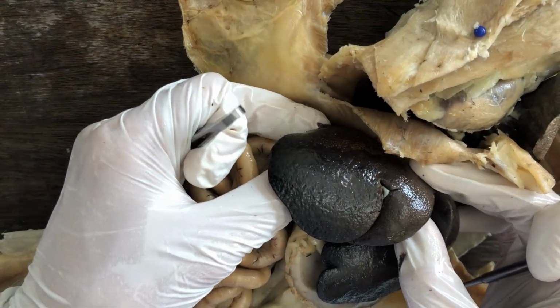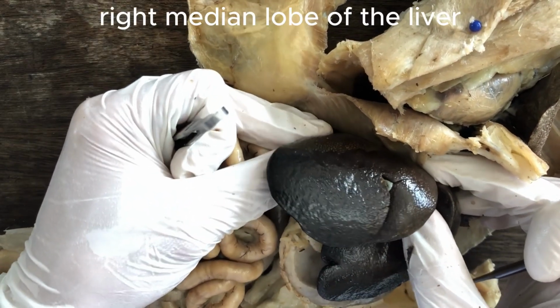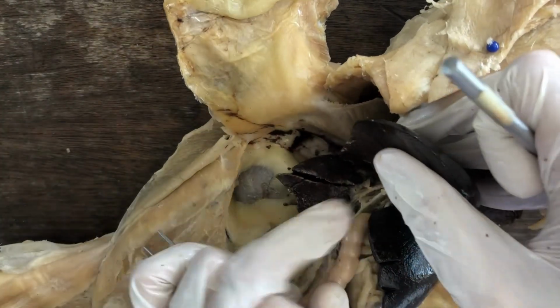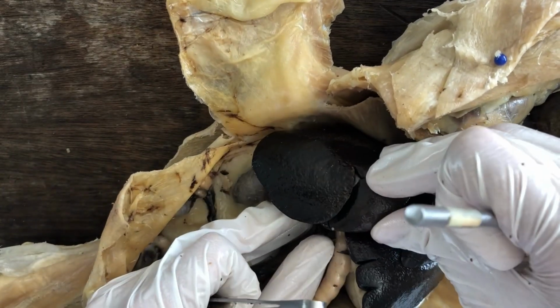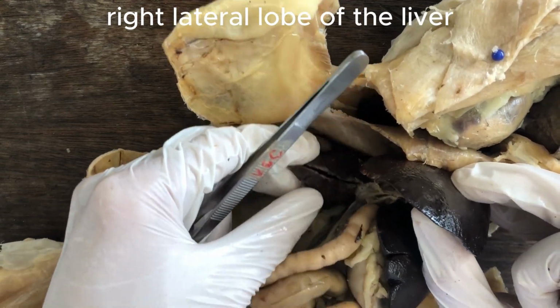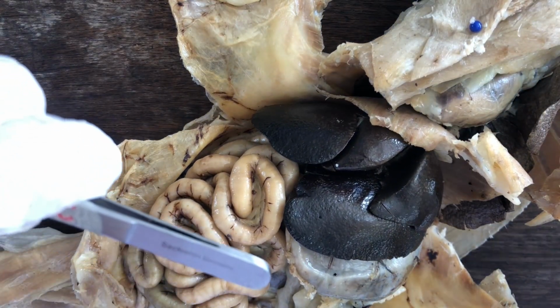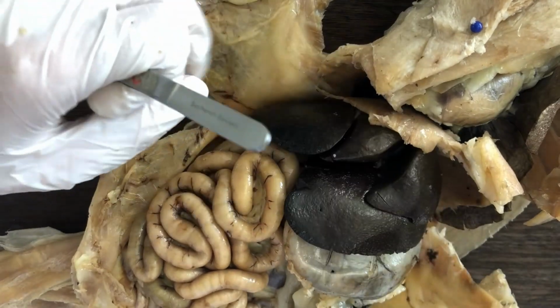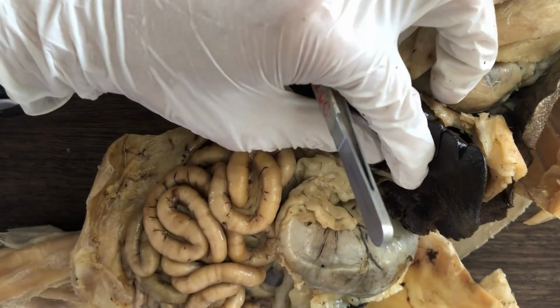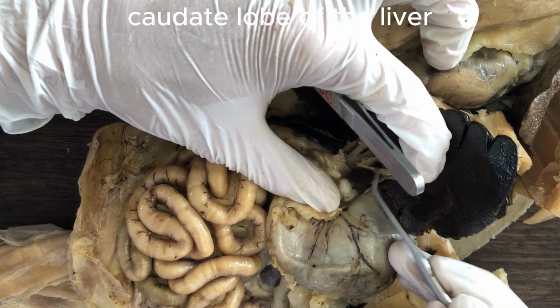So in this case, it's the reverse. The larger one is the median right lobe of the liver, and the smaller is the lateral right lobe of the liver, which is actually covered by the median lobe. So here's the lateral right lobe of the liver. And then there's an even tinier lobe called the caudate lobe. And in order to see it, you have to look dorsal to the liver. Oops, sorry about that alarm. So here's the caudate lobe of the liver.